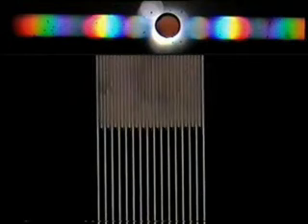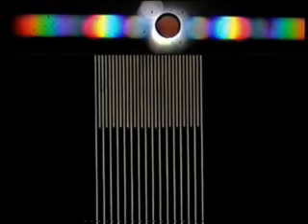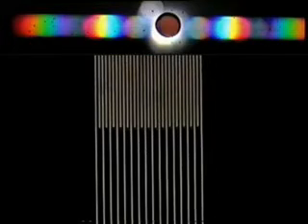There you see the effect. The lines are now bright, the background is black. Take the stop out and the lines are now black and the background white. The notion is that the zero order light lights up the background.